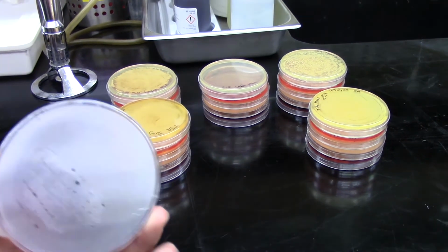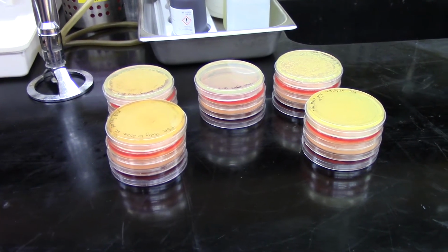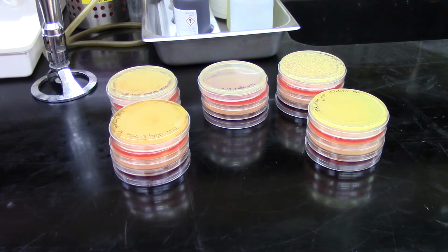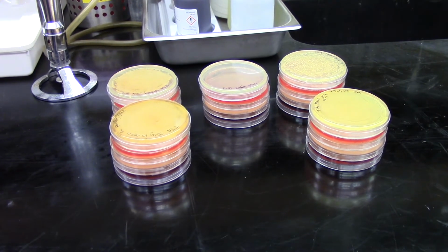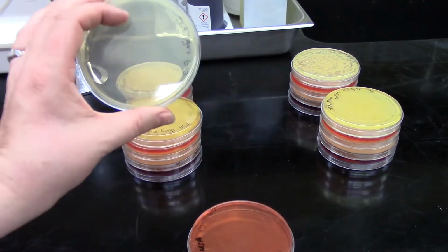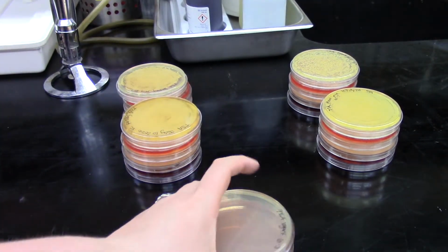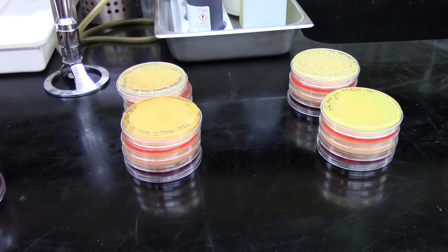So our yogurt, even though it was expired for over a year and a half, it actually didn't have any growth going on in that whey portion of it that we took a sample of. And surprise, surprise, when we did a further dilution, again, no growth on any of those plates.